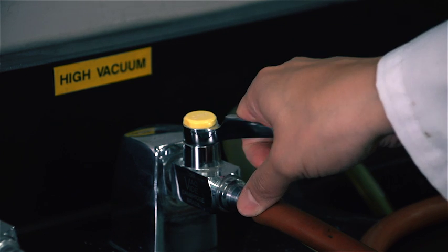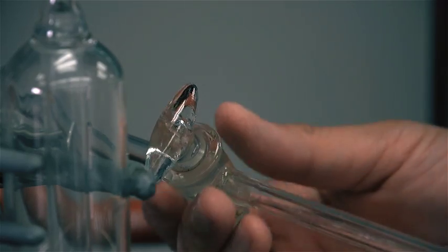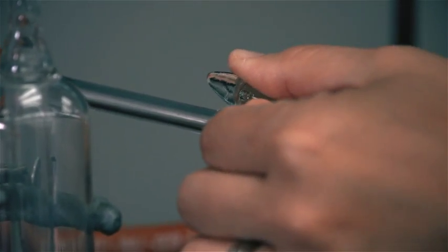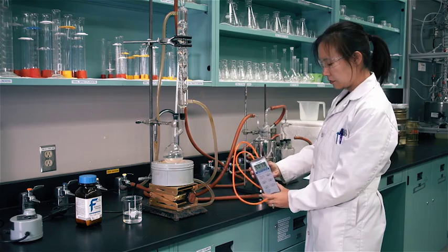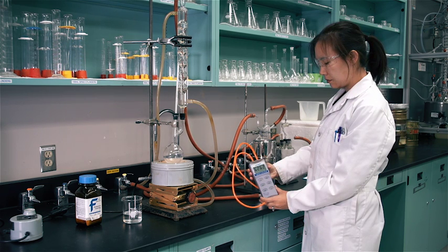The apparatus will now be tested for air tightness. Open the high vacuum tap. Open the stopcock that leads to the vacuum and evacuate the system to a manometer reading approximately equal to 650 mmHg.